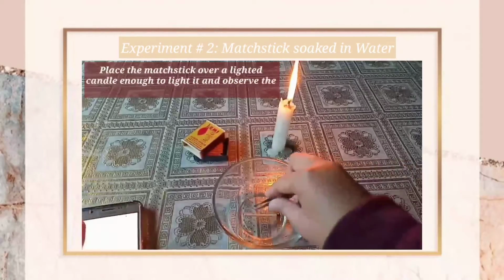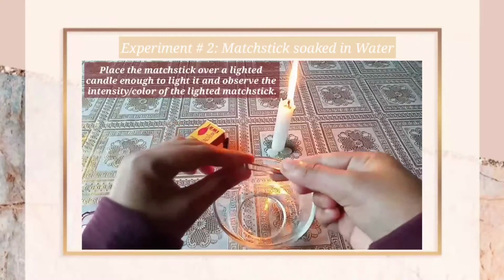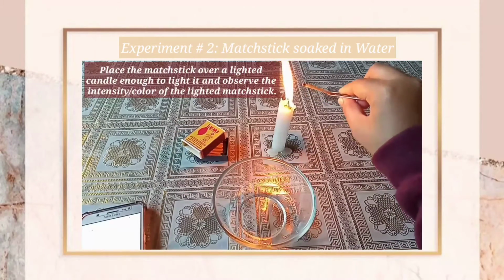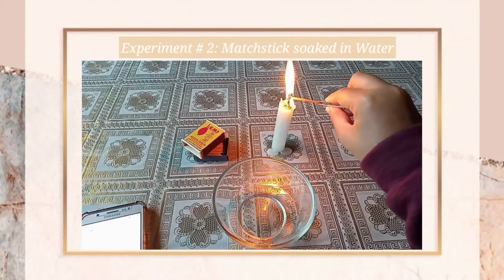After the 1 minute, place the matchstick over a lighted candle enough to light it and observe the intensity or the color of the lighted matchstick.